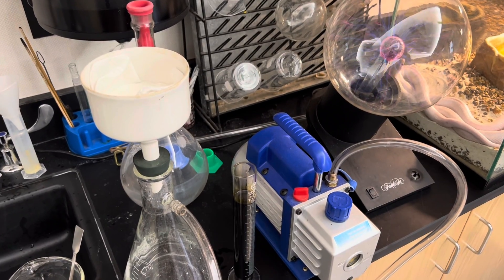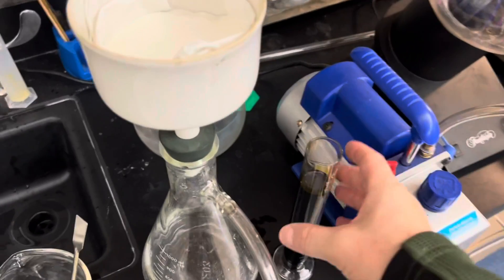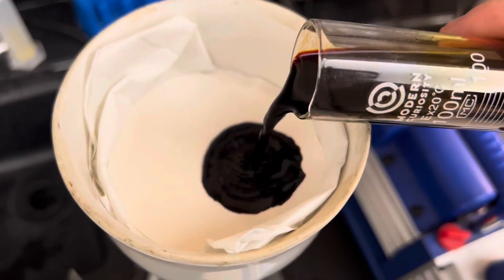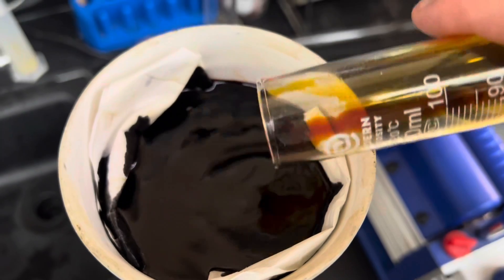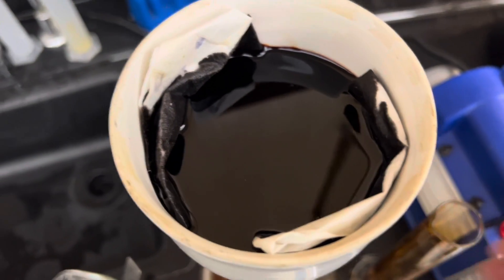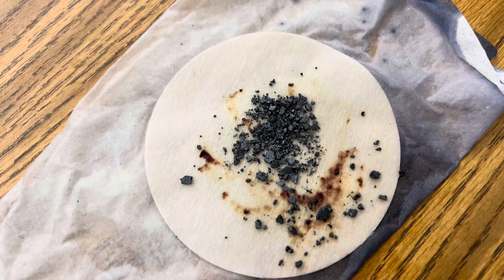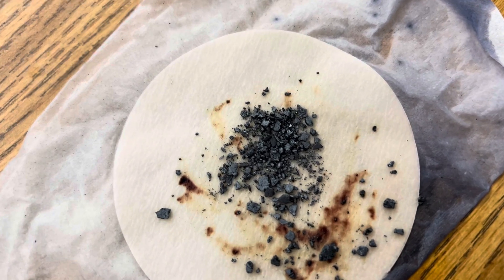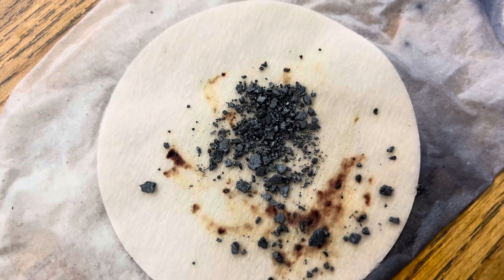I've hooked up my flask to my vacuum pump and I'm ready to start filtering my solution. I'm going to pour in my solution and start filtering it with my vacuum pump. After washing and drying this several times, this is our yield of elemental iodine in Ramseyland.